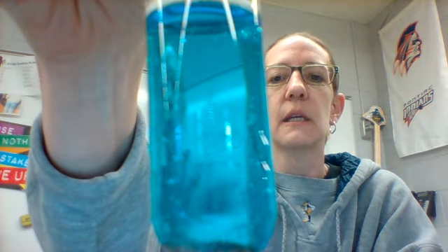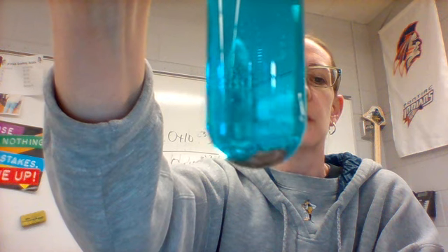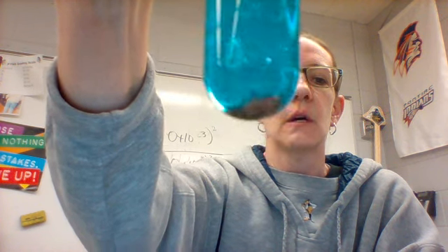If I swirl that around, you can see there are some pieces of solid swirling around in there, also down there towards the bottom. So you can see that one has definitely changed.